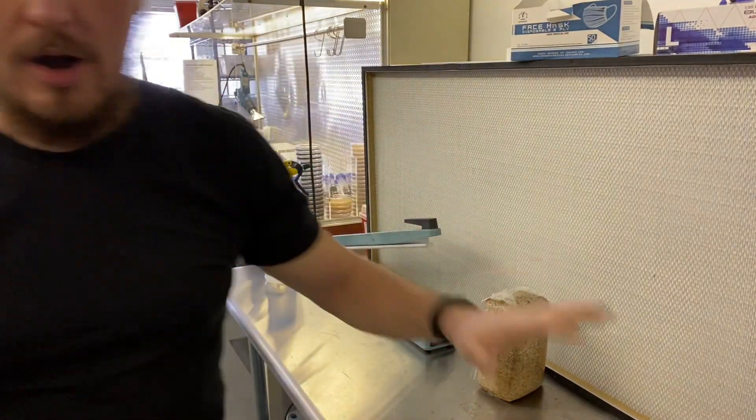So, this is the first. We're going to start at the basic aseptic technique. I've got a workstation here, I've got a flow hood. I've been wandering around, I've got stuff in my beard, I haven't washed my hands, I haven't washed my face — all that good stuff.